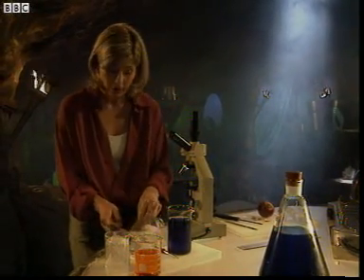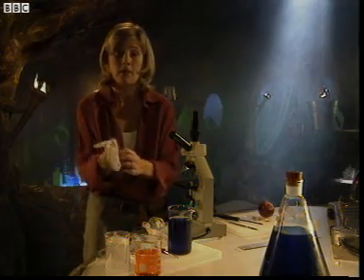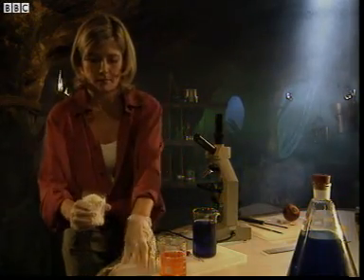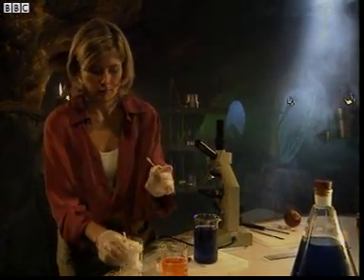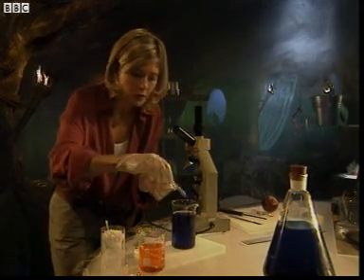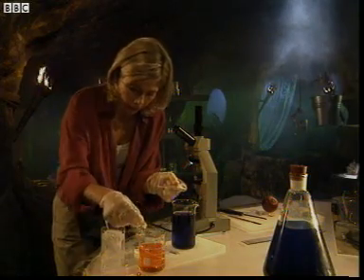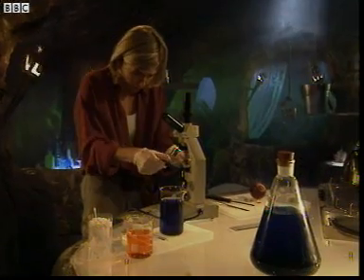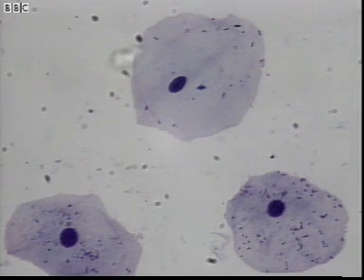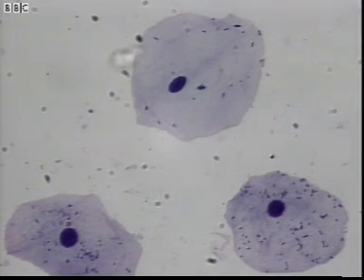But can we see any of our own cells? On this cotton bud, I've got some of my cheek cells. I'm going to use some of this blue stain, because it helps show up the cells. And then put on the cover slip. There.